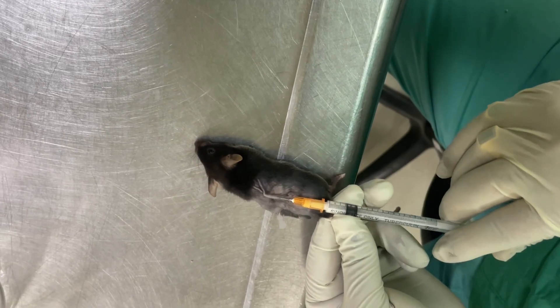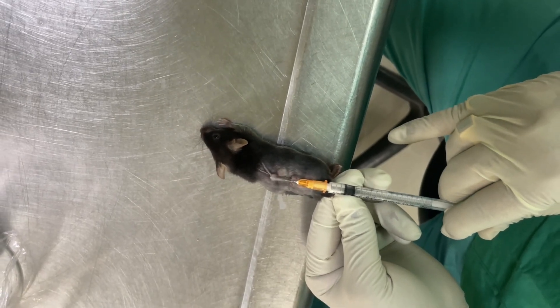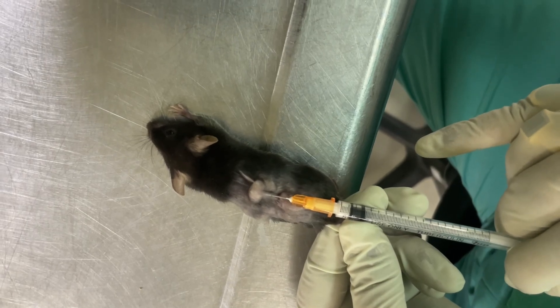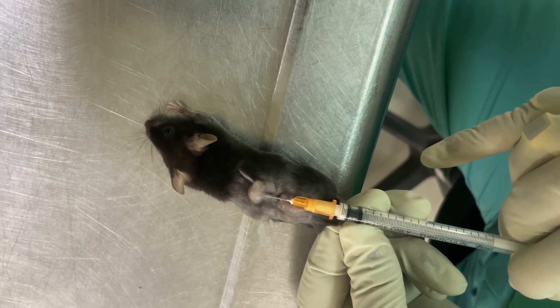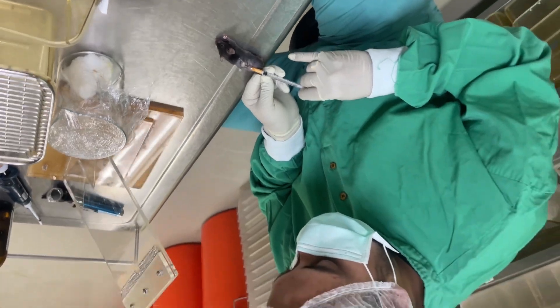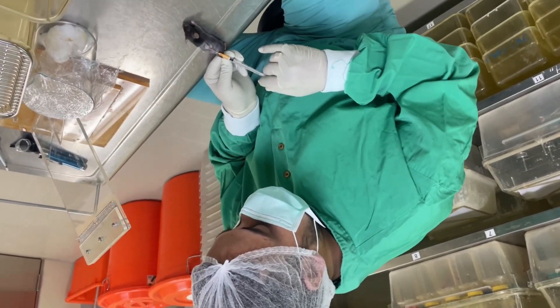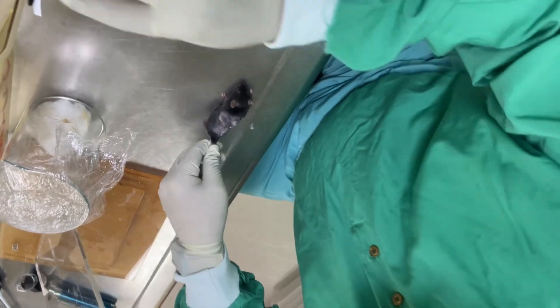At one site we will inject a maximum of 100 microlitre of drug. So if your requirement is 200 microlitre, then you need to inject at two different sites and take out the needle slowly.